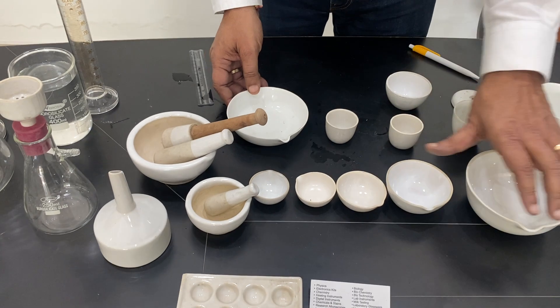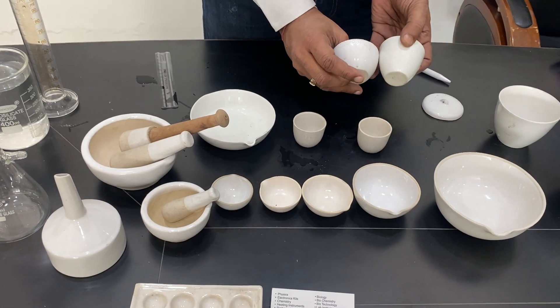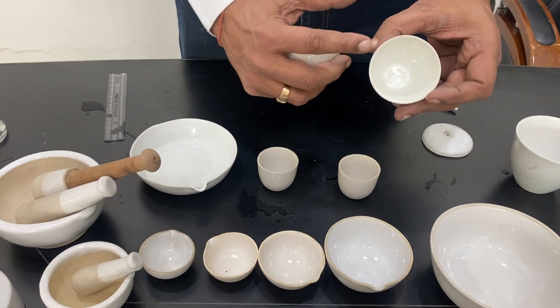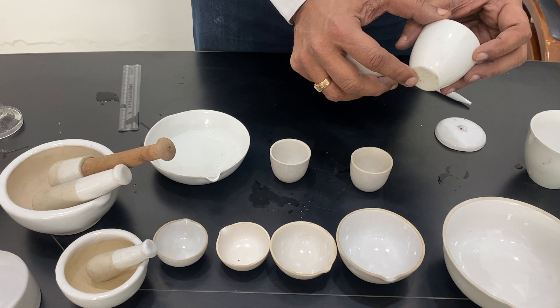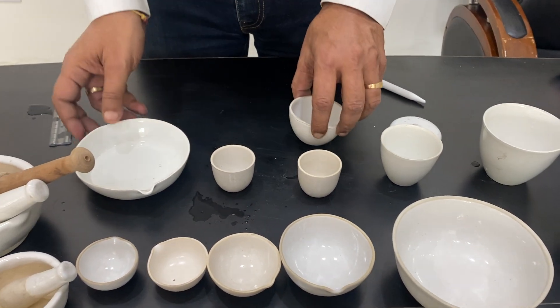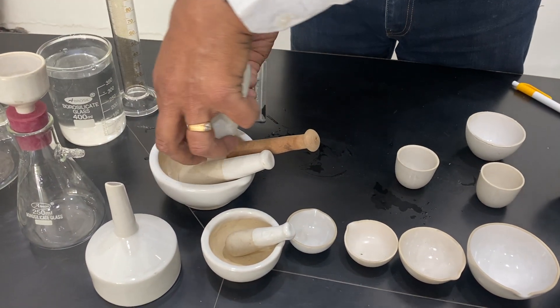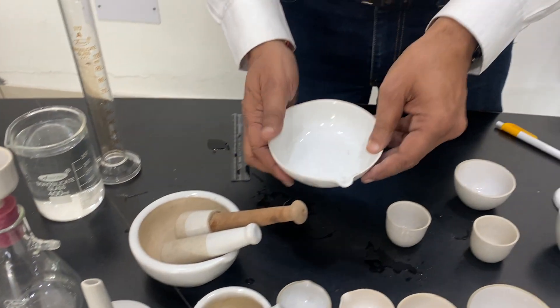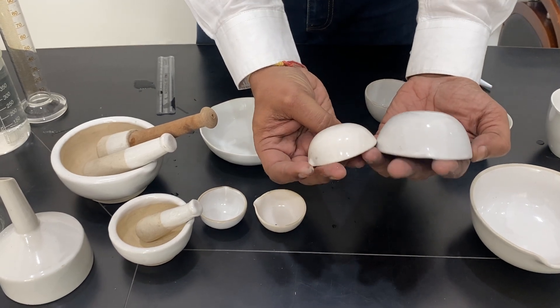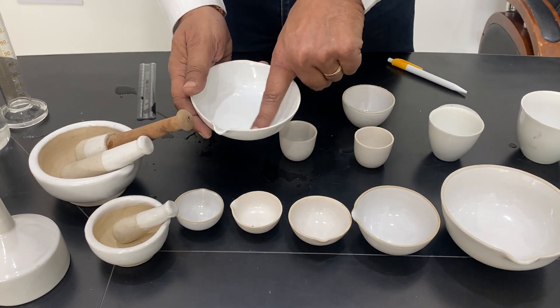Now between the china dish and the crucible there is another kind of crucible which is shorter, bigger, and broader. It is almost like a china dish but does not have a lip and is higher — mostly like a cup. This is called a crucible, and this shorter form is a low-form crucible. Another is a dish with a lip but with a flat bottom, unlike the round-bottom china dishes. All these are glazed inside with a lip.